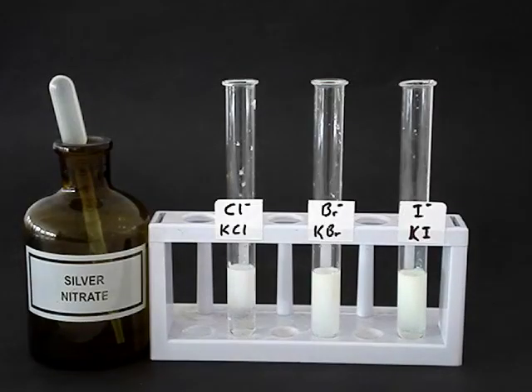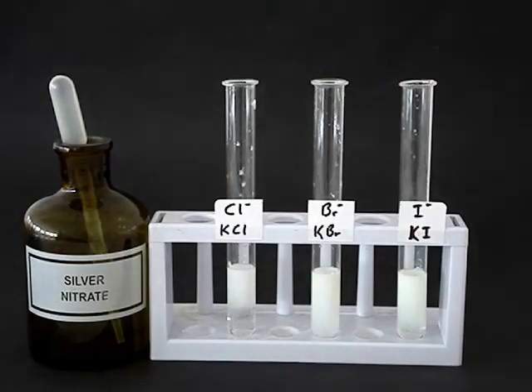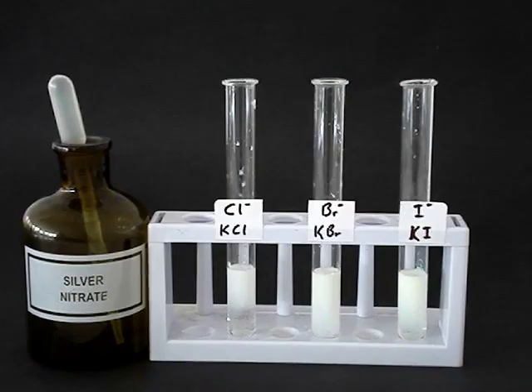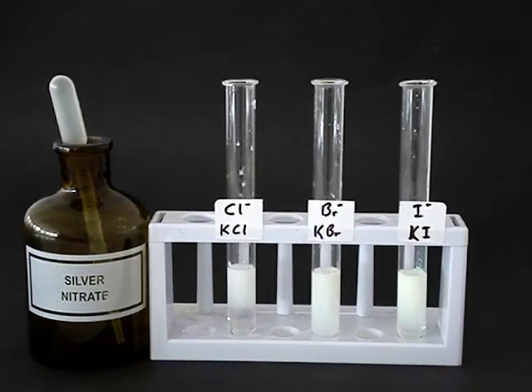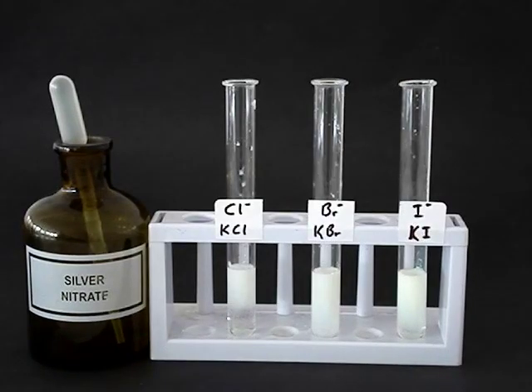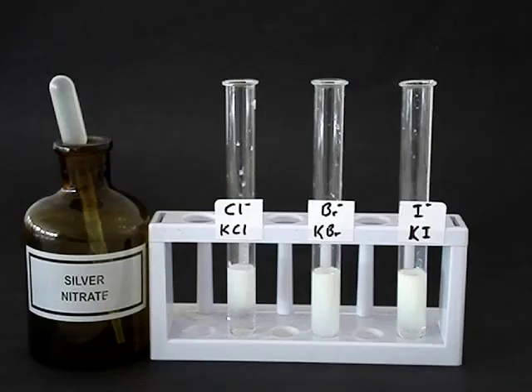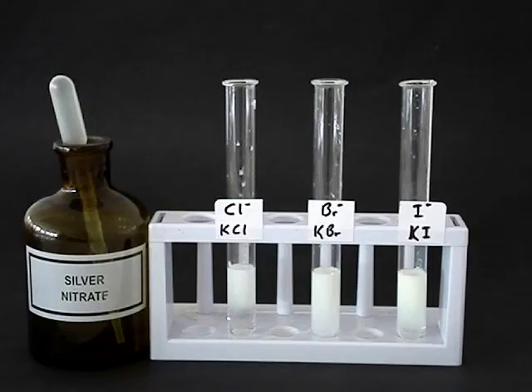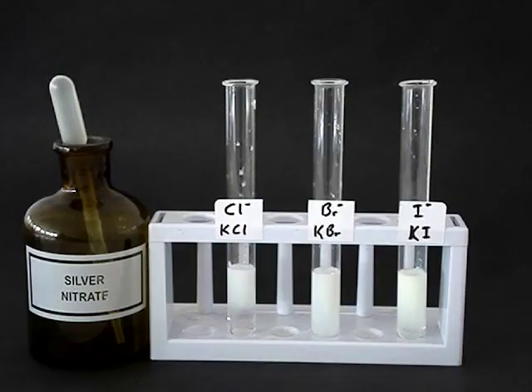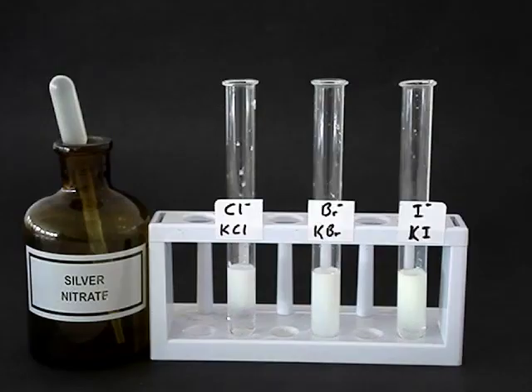We add some silver nitrate to the middle one and see a cream colored precipitate — from that we deduce there had been a bromide there. When we add the silver nitrate to the last solution, we see it turns yellow — from that we deduce that yellow silver iodide formed, so there must have been an iodide present.